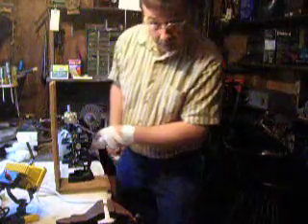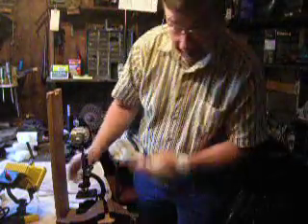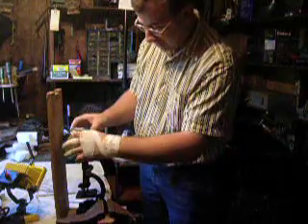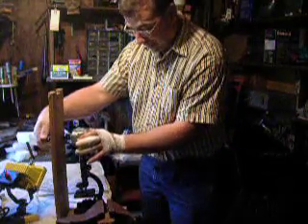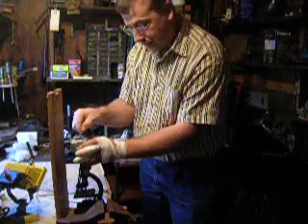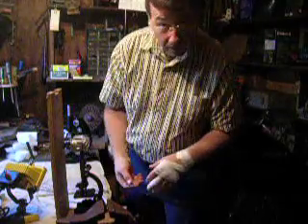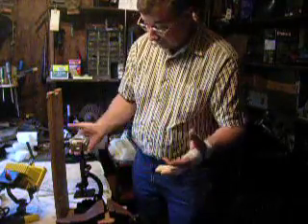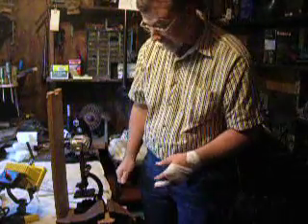And it's all a visual thing. When you see it in the camera sight, you know you have the optical alignment, and you just adjust it. Once you get it so that the circle is dead center, you do a little zoom in, and then you can make videos of anything that you can find in your bird bath or your water or anything like that.